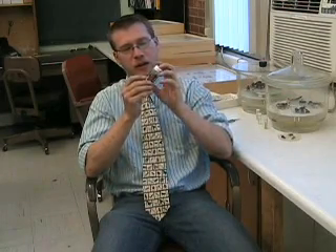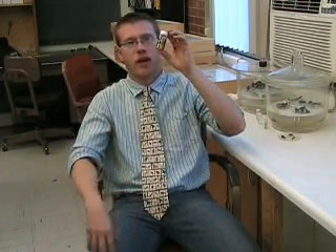This here is a banana spider, and it is in a jar of ethanol. We usually use 70% ethanol, and you put it in vials. We prefer to use snap-cap vials, that way we don't have to constantly refill these specimens' containers with alcohol.